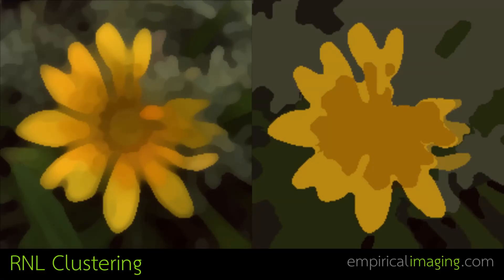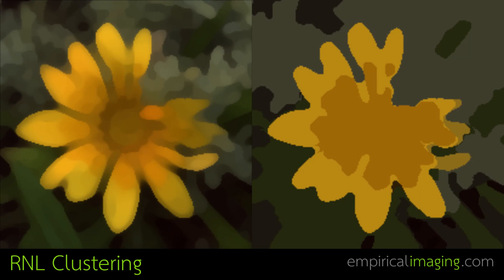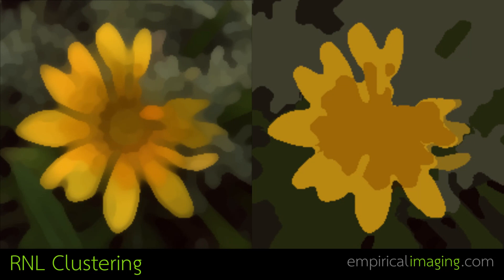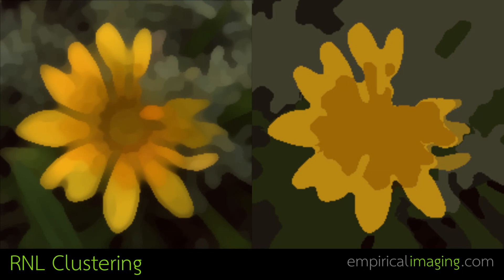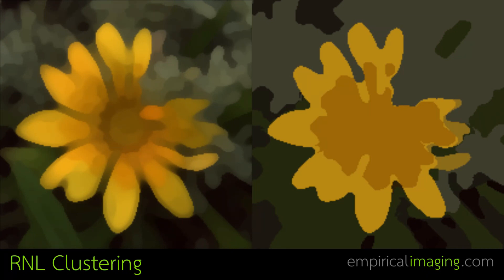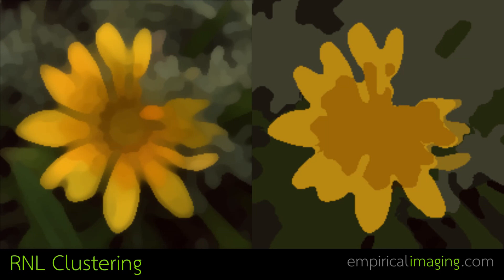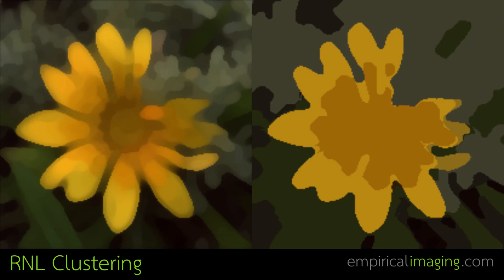Next, the image needs to be broken down into a manageable number of distinct colours in order to apply some of the image analysis techniques. To do this we've developed the Receptor Noise Limited Agglomerative Hierarchical Clustering method, or RNL clustering for short. This method allows you to break the image down with only knowledge of the cone ratios of your receiver's visual system. Unlike other methods such as k-means clustering, you don't need to know how many different colours you expect to have in your image, and importantly it uses visual modelling to look at chromatic and achromatic colour and luminance detection thresholds when breaking down the image.